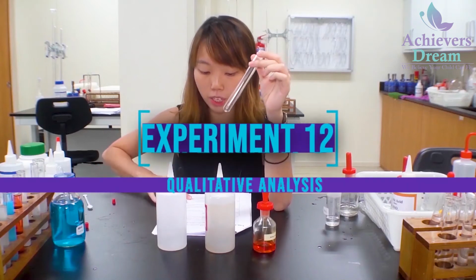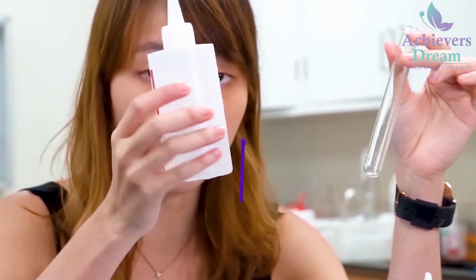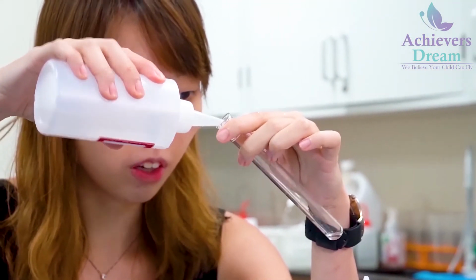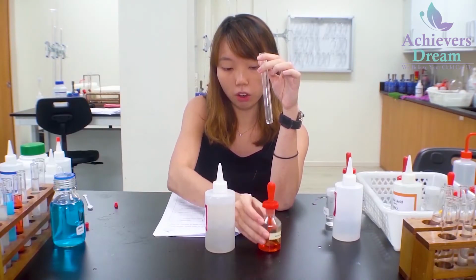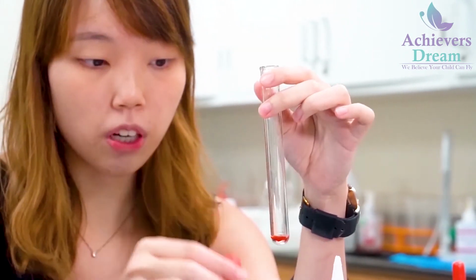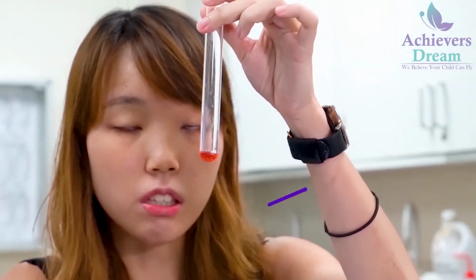Okay, so today we'll be doing experiment 12. So for 1A, I'll be placing 1 cm cube of dilute sulfuric acid in a clean test tube. Okay, then I'll be adding in a few drops of methyl orange indicator. So upon adding in methyl orange indicator, you notice that the methyl orange has turned red.